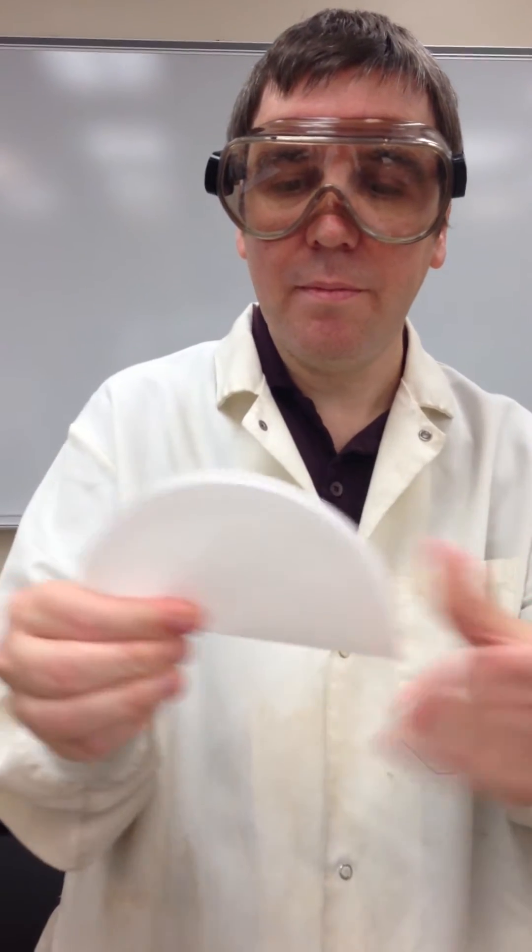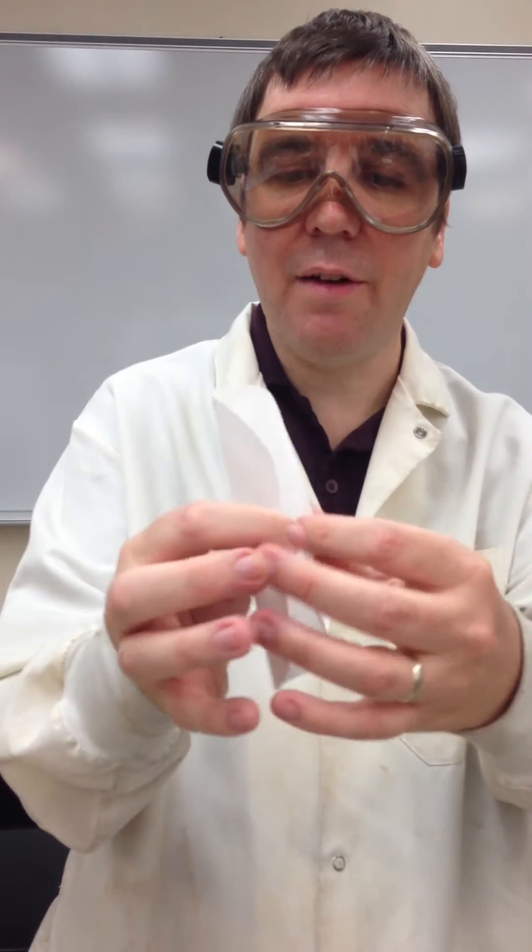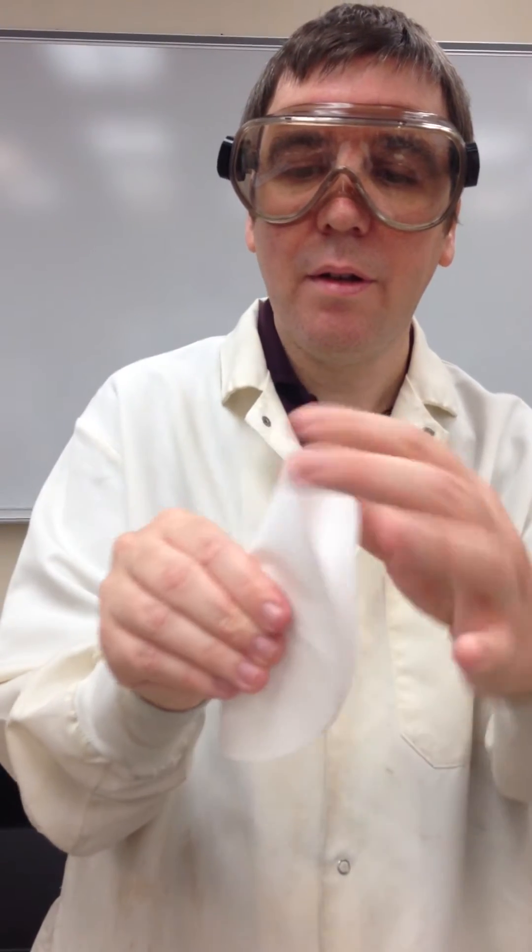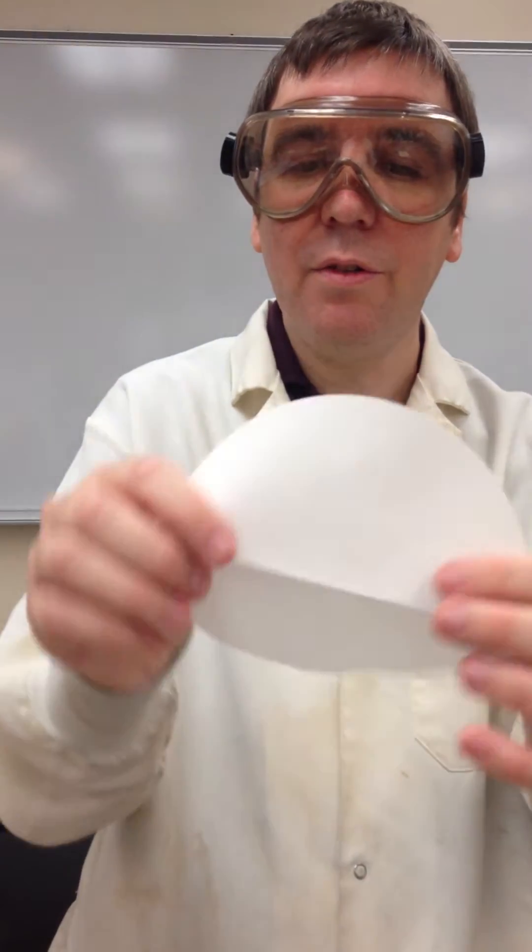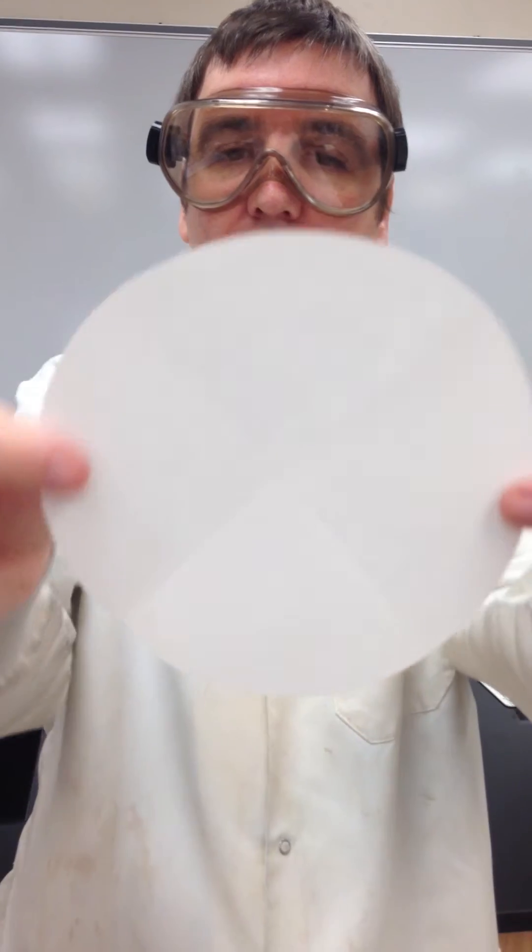Fold it in half, open it out, and fold it in half again. Ensure that all the creases are pointing to the outside, or if turned over, they're all on the inside.